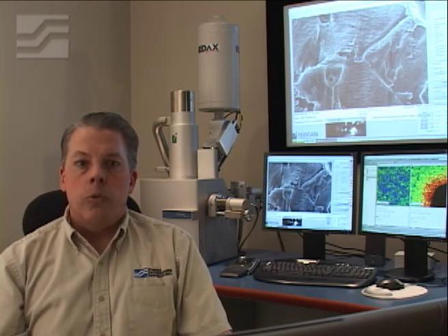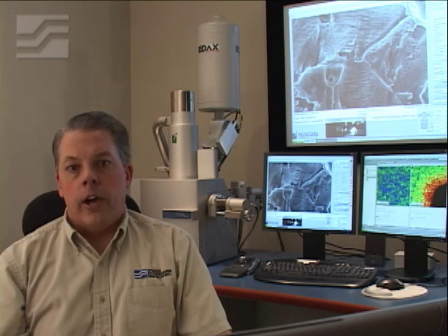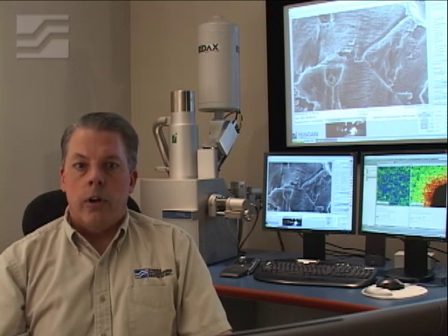A scanning electron microscope is one of the best ways to look at objects very closely. We can magnify objects up to about 100,000 times. We take high-quality digital photographs of everything we see.